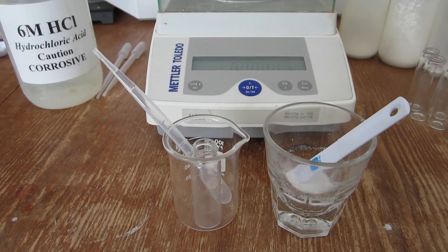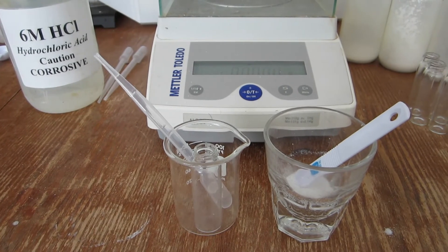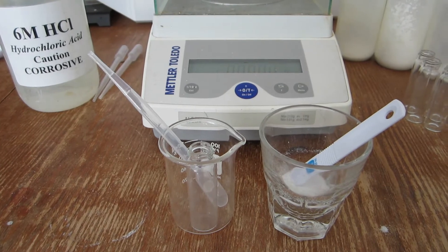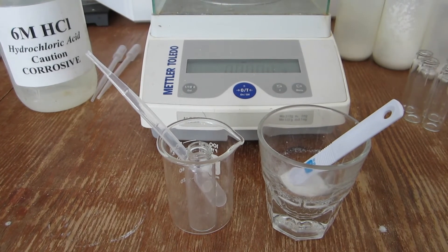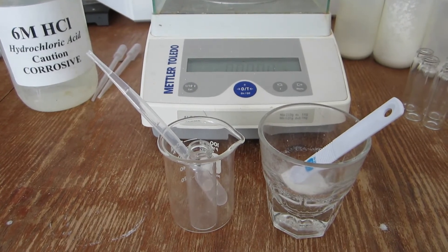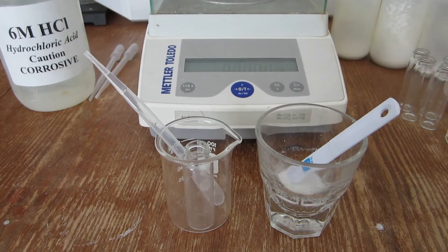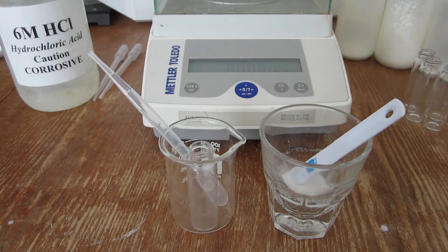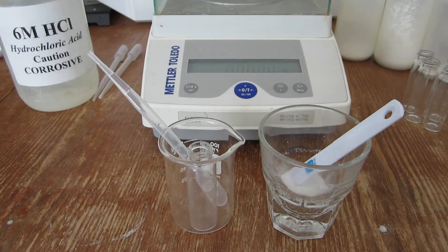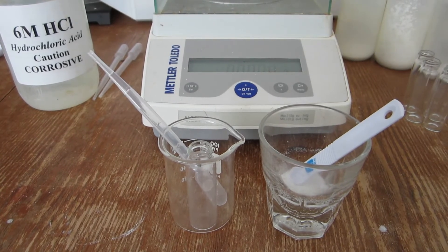In this unknown carbonate sample, it will be reacted with hydrochloric acid in three different trials. In each trial, you will determine the mass of carbon dioxide, the mass of carbonate, and the percent carbonate. In the end, you will take the average of these three trials to determine your average percent carbonate, and then compare that to a set of standards to identify what compound the unknown is.